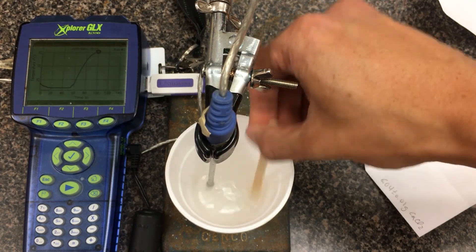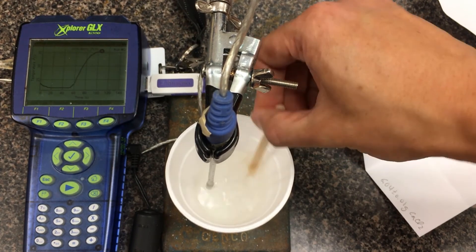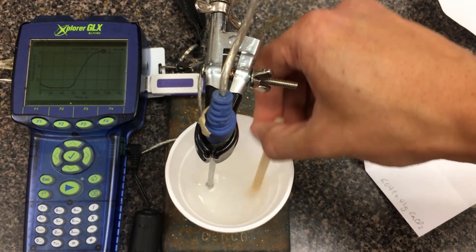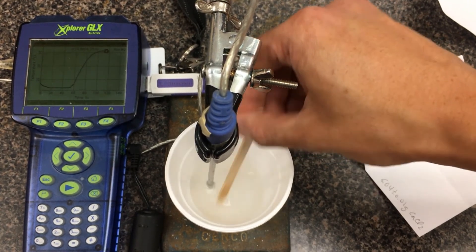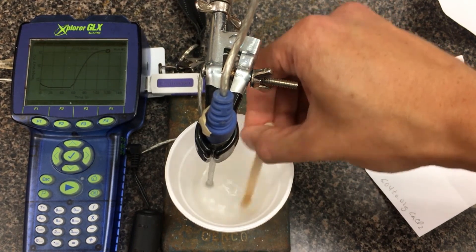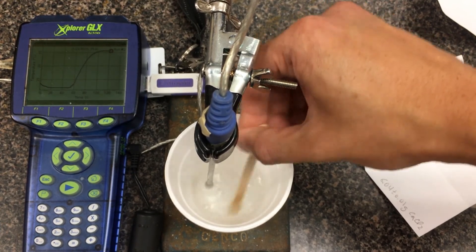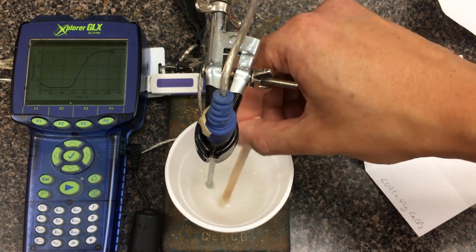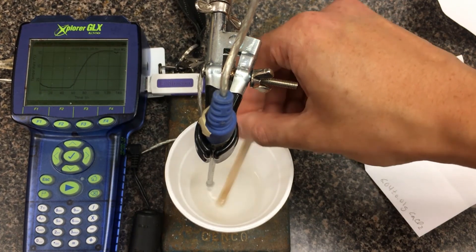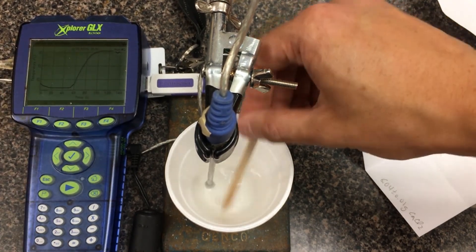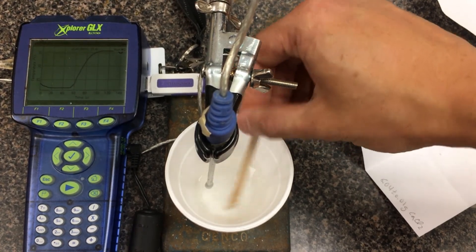Once this has been fully dissolved, it's going to peak in temperature. We'll give it a little more time. When we take the graph, we can do some extrapolation to figure out how hot it could have been if the reaction had all happened in an instant. I don't really feel any pebbles on the bottom of the styrofoam cup anymore. It's an indication that the pebbles have been dissolved. I also notice that the temperature is steadying out on the top, so it should be pretty closely done. It does say run number two, so both runs will be on the same graph.